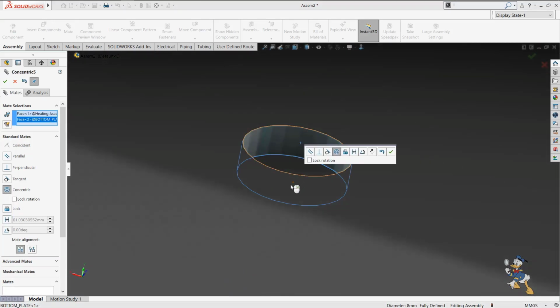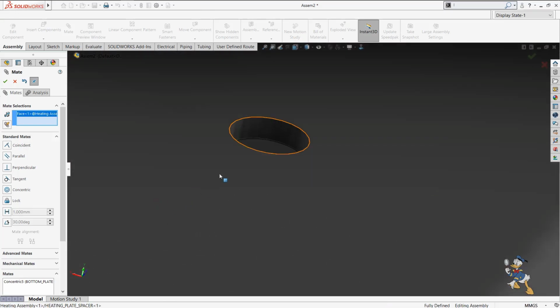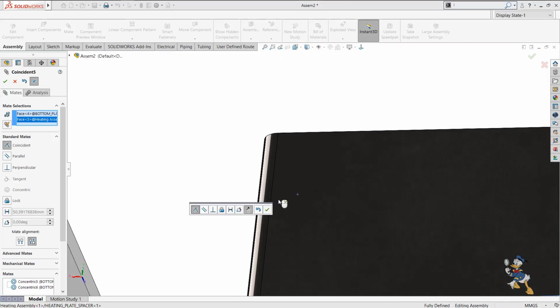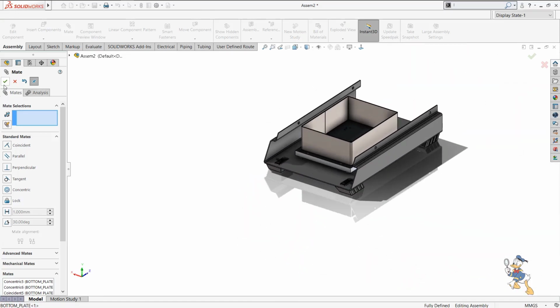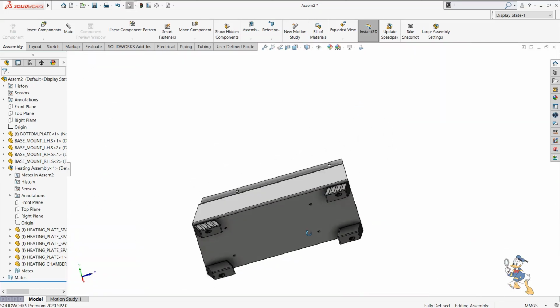respecting this, and it is a concentric. Suppose I need to make this one concentric as well, so I'll make this one concentric. I just need coincident with this, so I have made coincident to this value as well. So now it is okay for this.